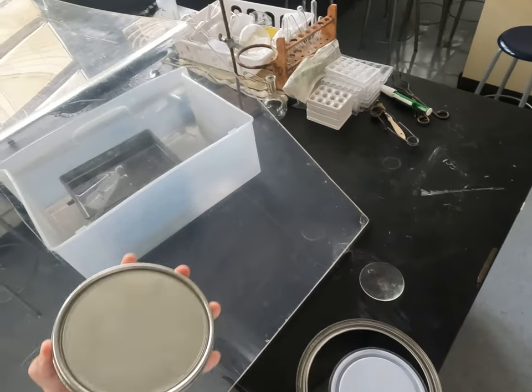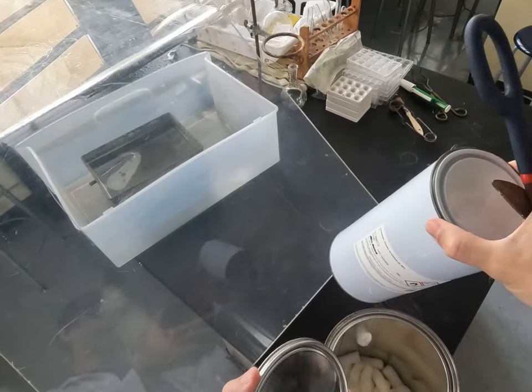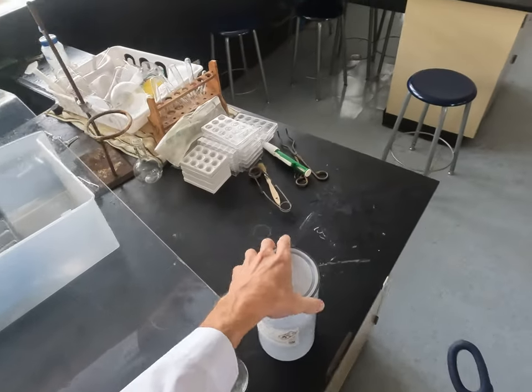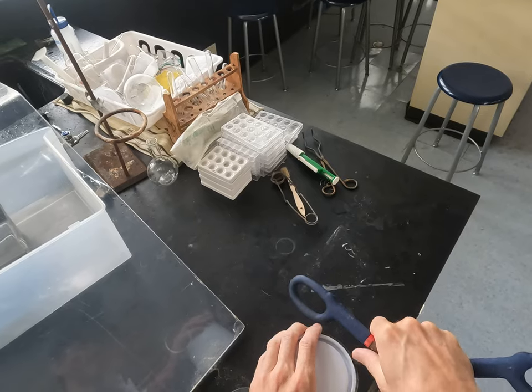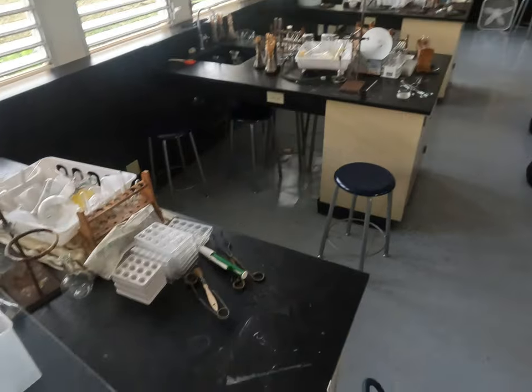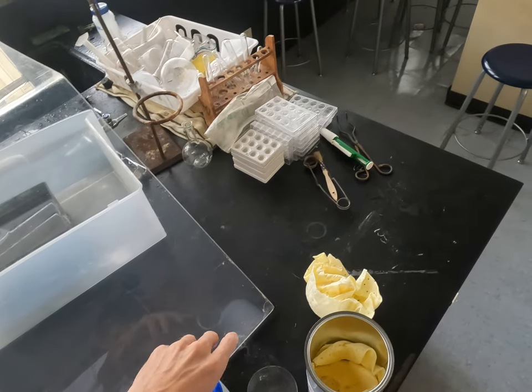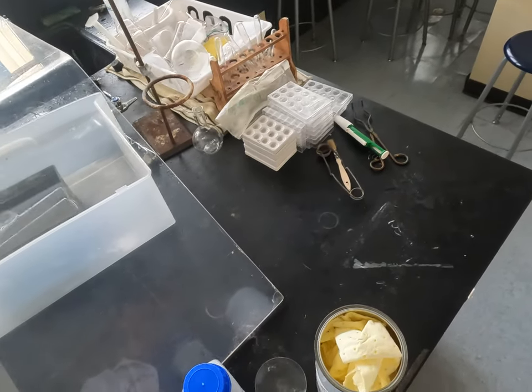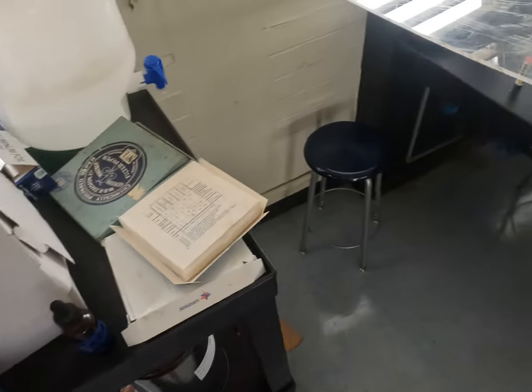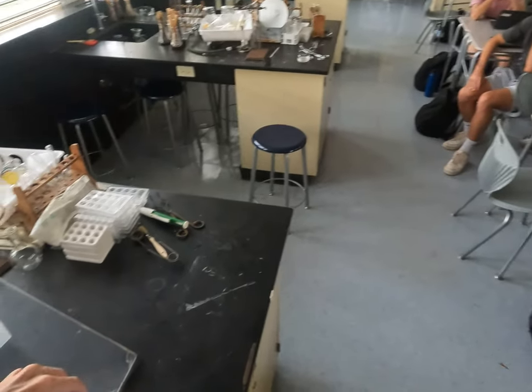We should be reaching the point where we know a little bit more about this. So this is inside a can, inside of another can — potassium chunks. Where's potassium on the periodic table? K. Yes. It's inside a jar, inside of a can, inside of another can. And it's in mineral oil.